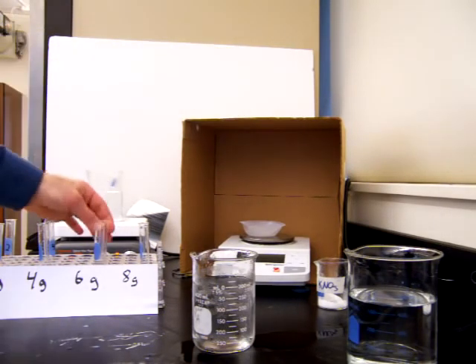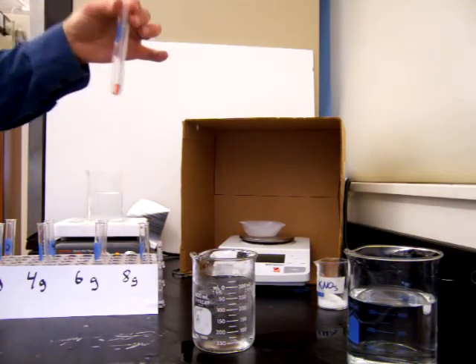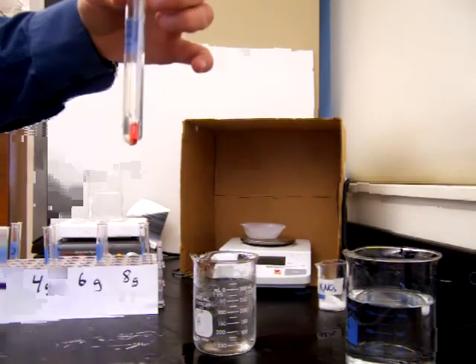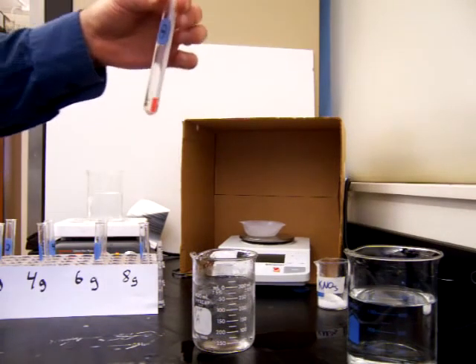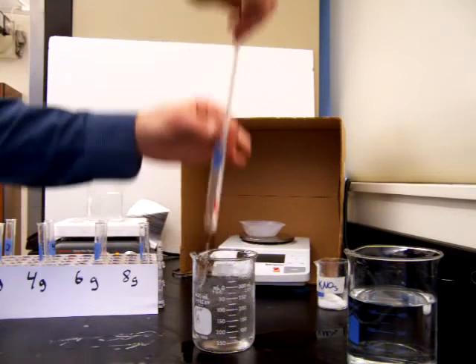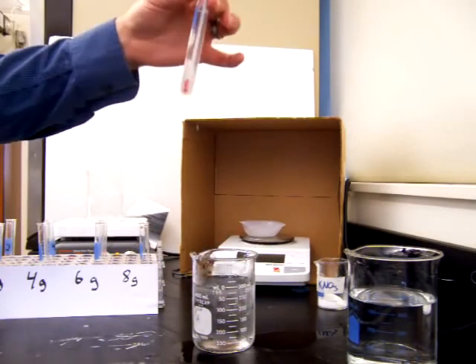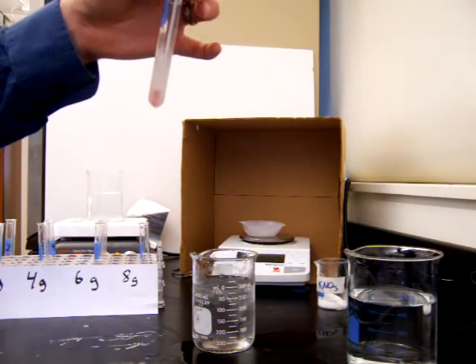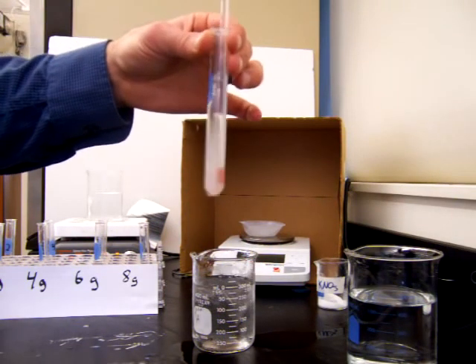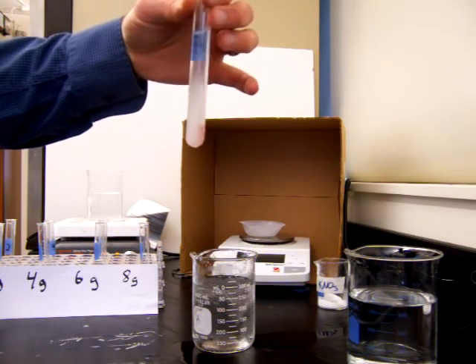And moving on to our final and highest concentration. So this one contains 8 grams of potassium nitrate in 5 milliliters of water. And this one, we won't have to cool very much. We'll just dip it in the cold water kind of briefly. And already we see some crystals forming. And that occurred at 83 degrees Celsius. 83 degrees Celsius, and we got crystals of potassium nitrate forming in that solution.